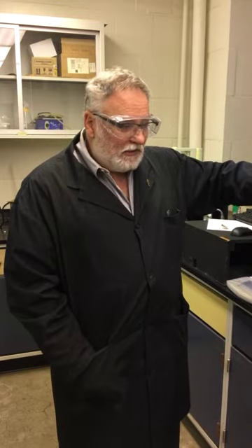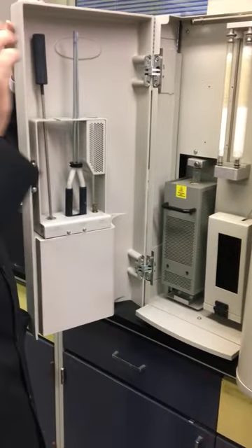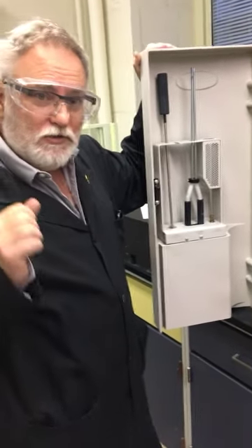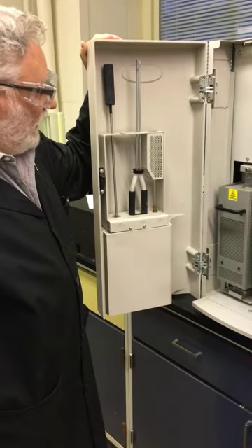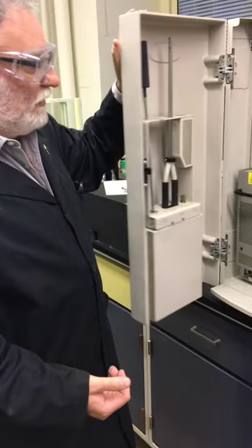After that is done, the other portion of the gas is sent through a third furnace. This one is full of copper turnings, I forget the temperature, but it's going to strip out the oxygen and convert our NOx to nitrogen gas. That nitrogen gas is going to go through a thermal conductivity detector, and we know the thermal conductivity of helium, and we can work out what the concentration is from that change in thermal conductivity when nitrogen gas is present. Only one of the NOx gases is infrared active, and so we can't use infrared for that case.